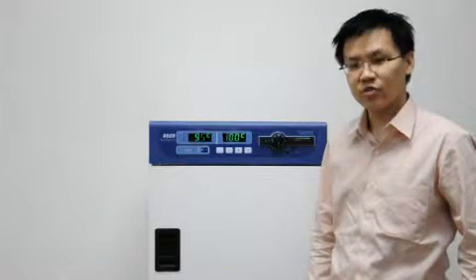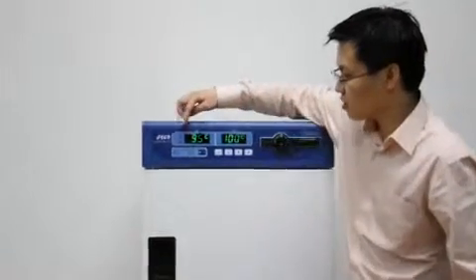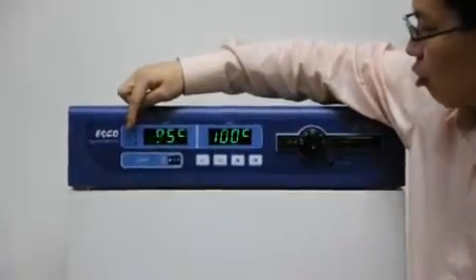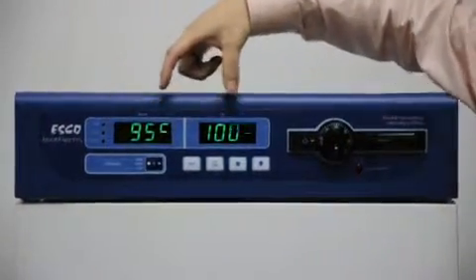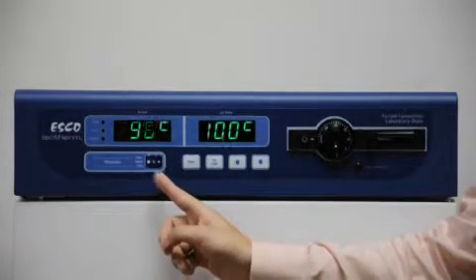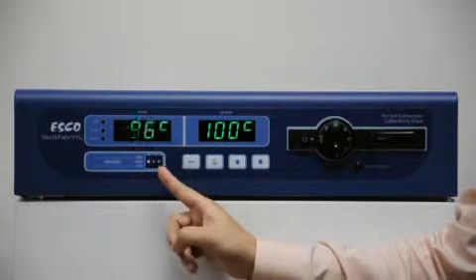Next I'd like to introduce the control functions on ESCO ovens. We have three LEDs on the left: heat, alarm and program, two temperature displays, an actual temperature display, set point temperature display, and a program key for use when the oven is operating in the program mode.